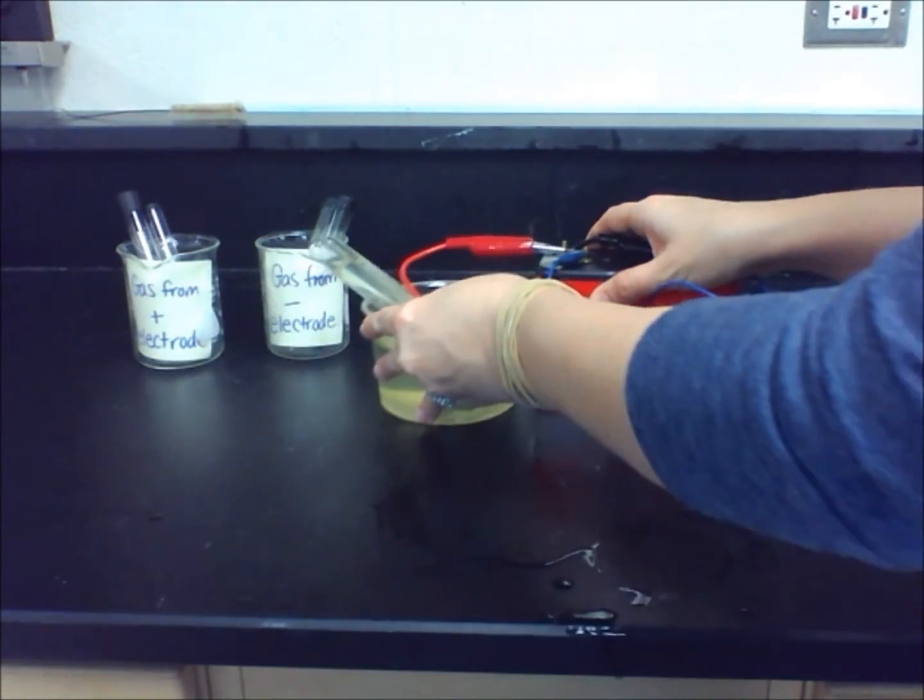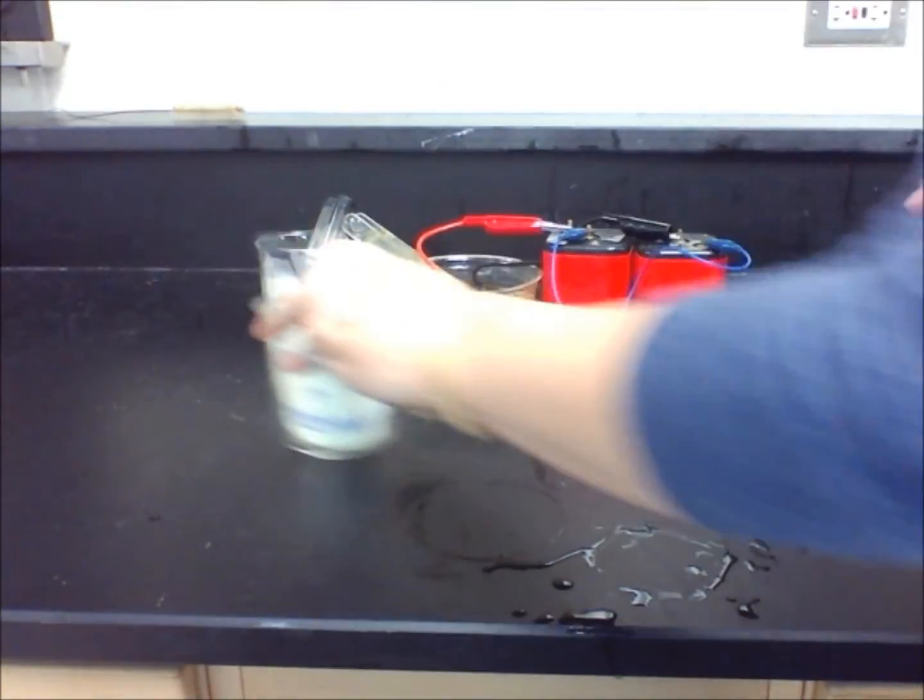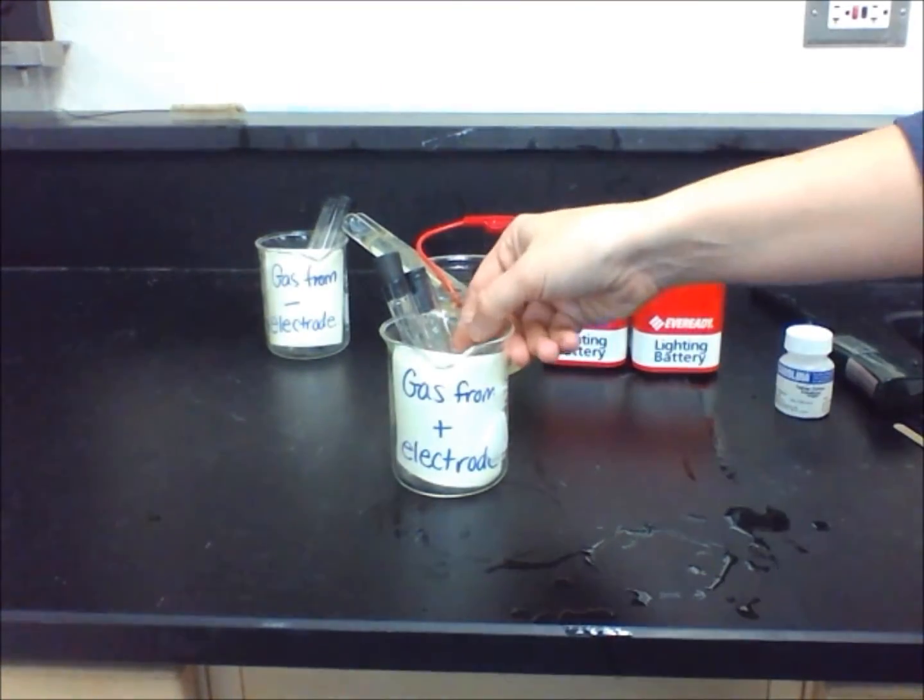Did you notice that the negative electrode is filling almost twice as fast as the positive one? Keep that in mind when we discuss the next part.